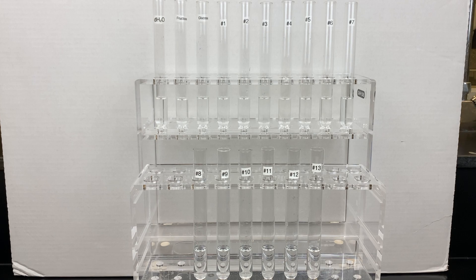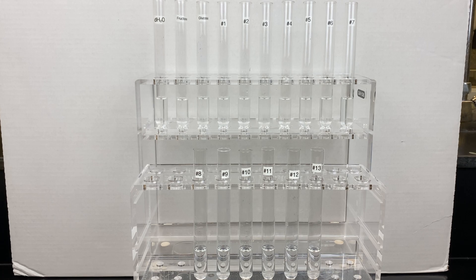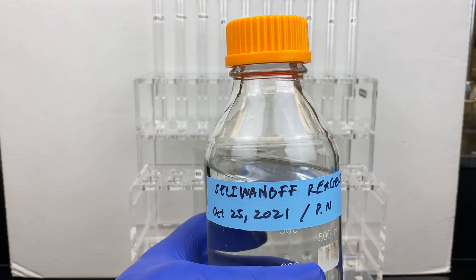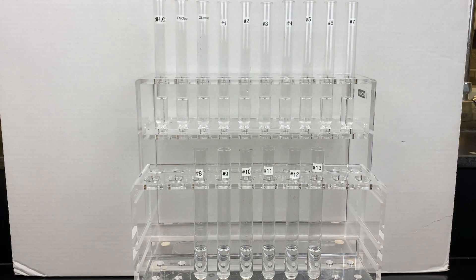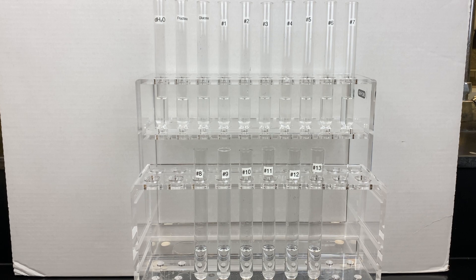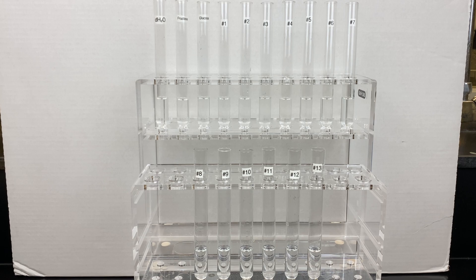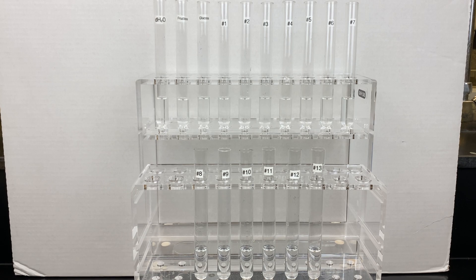Five mils of Seliwanoff's reagent is added to 200 microliters of sample. The ring structure is opened up and then it can react with the chemicals in the Seliwanoff reagent. Seliwanoff's contains resorcinol and hydrochloric acid. The byproducts produced by the dehydration of ketoses react faster than the dehydration of aldoses. This will then react with the resorcinol to create a cherry red color, which is why ketoses will appear cherry red whereas aldoses will only appear to be a faint peach color.